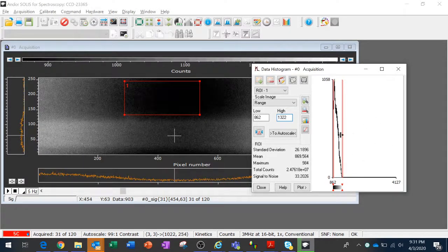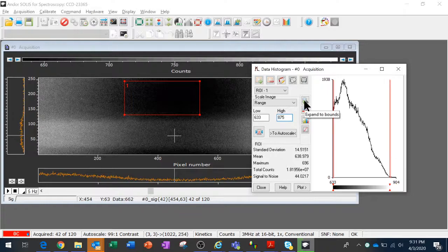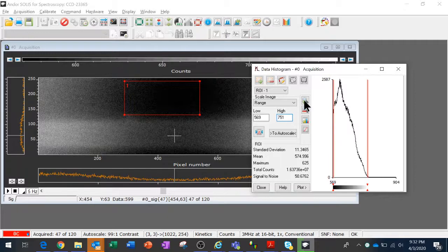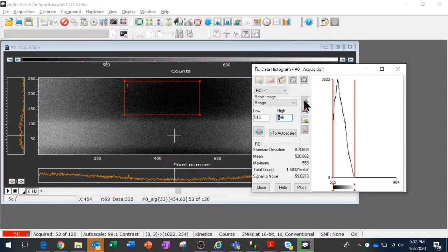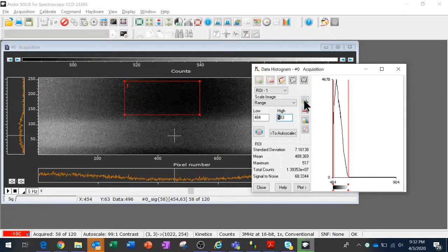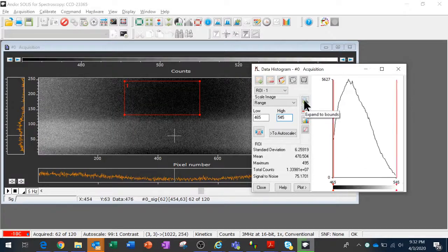So this is a histogram of my counts. Across each value of possible counts, it's going to have the number of pixels that show up with that number of counts. And I'm going to zoom in and blow up the distribution again. So not only is it becoming lower, our mean value collapsing towards 0, but there's still an analog offset applied before the ADC. But it's also going to become a tighter distribution. So our background will become not only lower, but more uniform, which is obviously very important. I'm going to zoom in again.